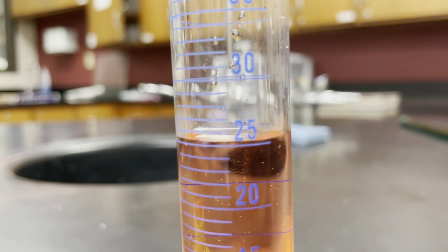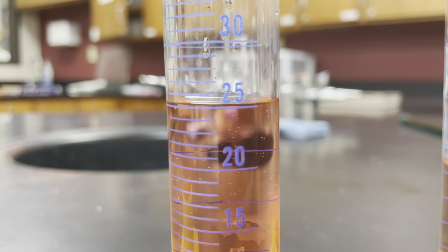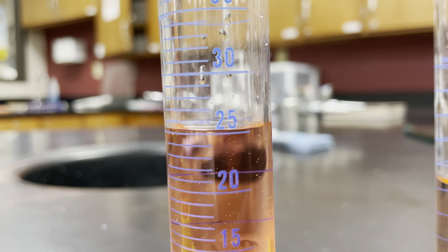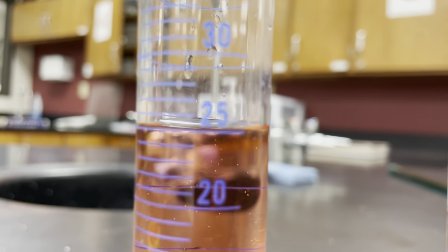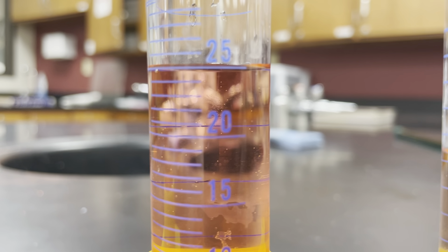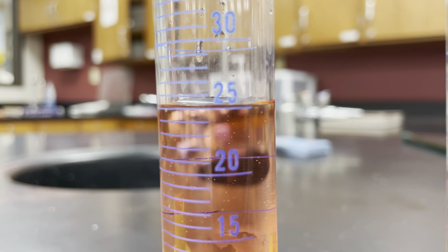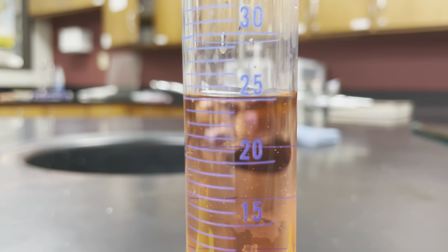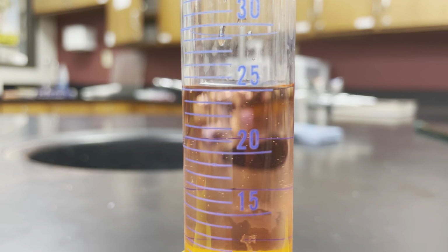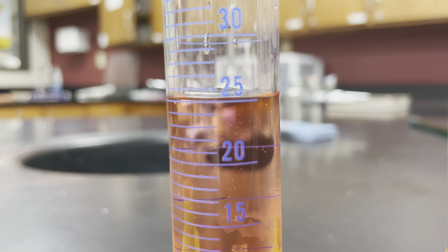Okay, so these ones have lines for ones. So this is going from 20 to 21, 22, 23, 24, 25, just like the other graduated cylinder. So in this case, let me see if I can get this on eye level a little bit better. Okay, that is darn near on 25. Now if I wanted to say this is exactly on 25 milliliters, I wouldn't just say 25 and then stop there, because I can know out to the tenths place here, or at least I can guess and read between the lines here.